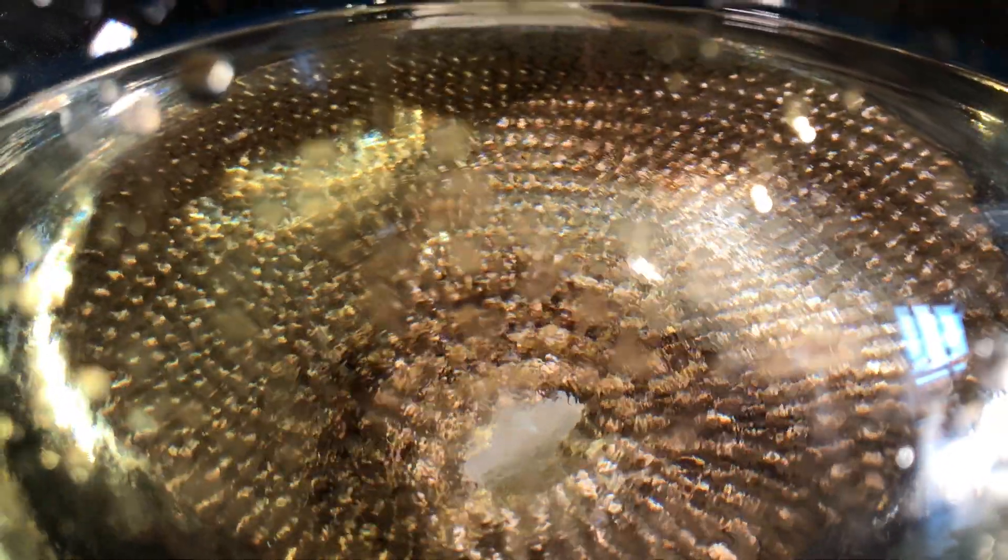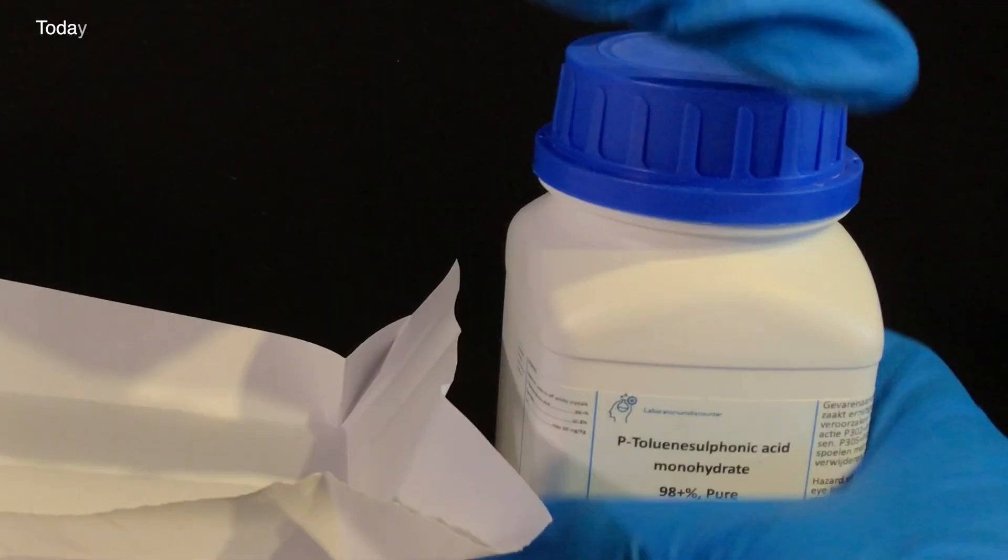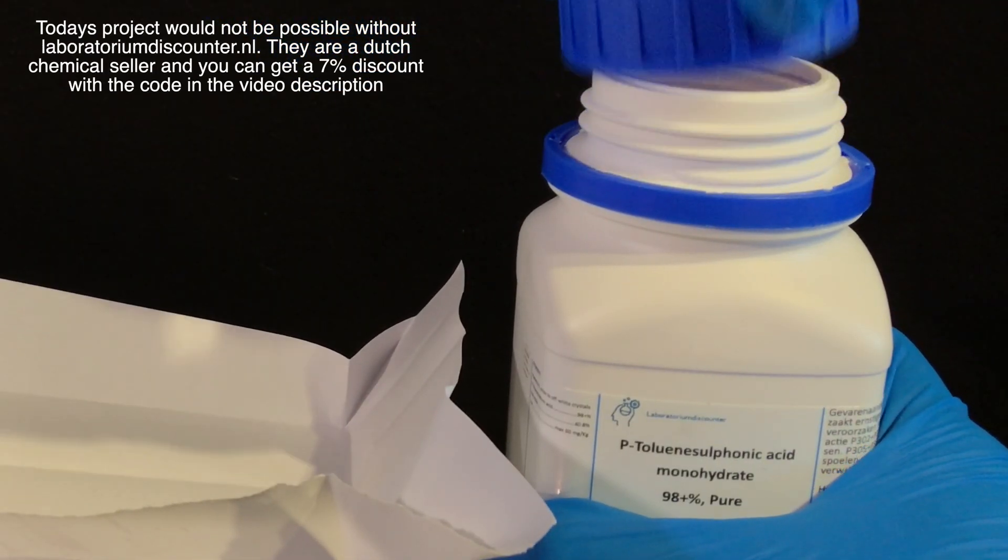In the end we observed this rainbow-like effect in the flask. Unfortunately it didn't turn out great on camera. As a catalyst we're going to need a proton source.